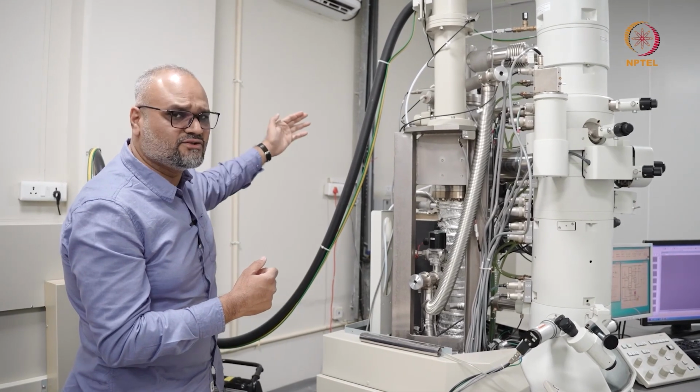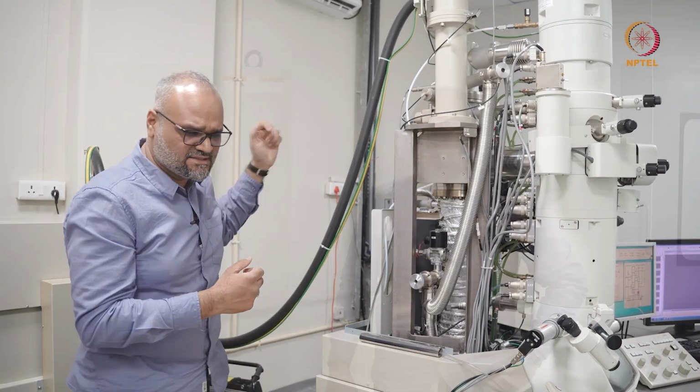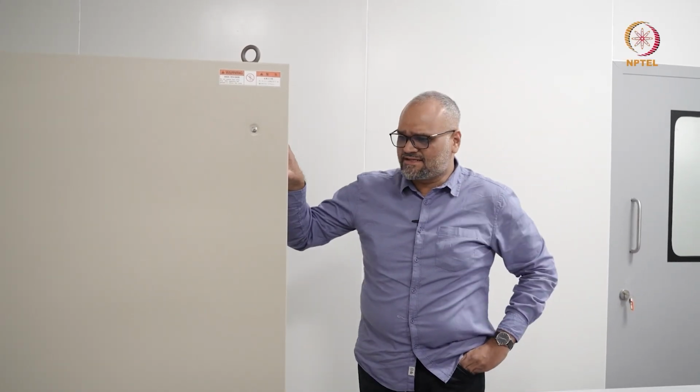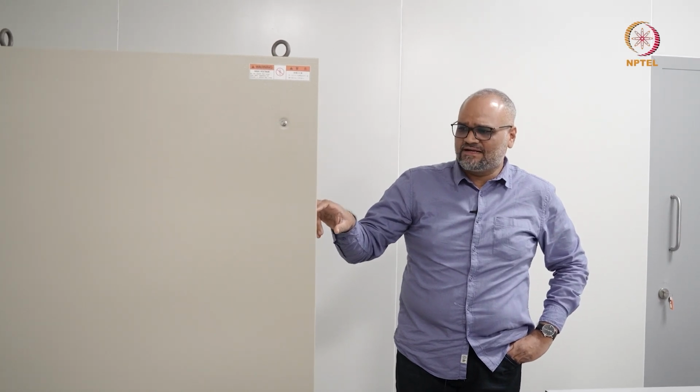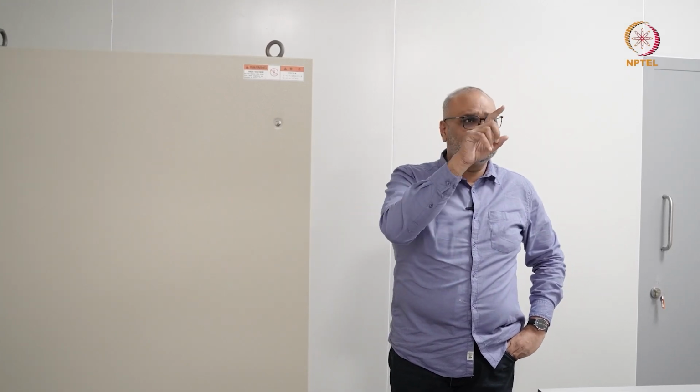We'll move gradually to the other side where the electric console is. So here's your electric console, and typically once you come to the microscope, a good practice is to check if this LED is on, if you are using a JEOL instrument. You can look at what the current reading here is for the sputter ion pump. This gives an indication that your ultra high vacuum, especially the vacuum reading on the sputter ion pump, is at a good value. And once you check that all this is ready, you can start by loading a sample and inserting the holder into the microscope.